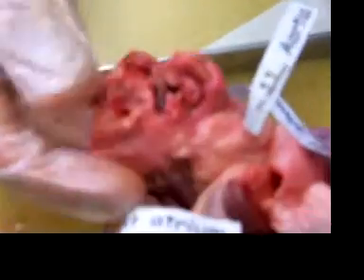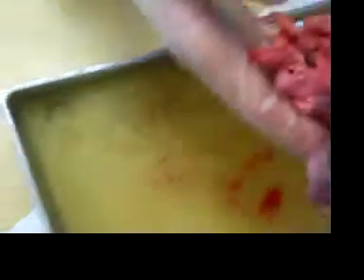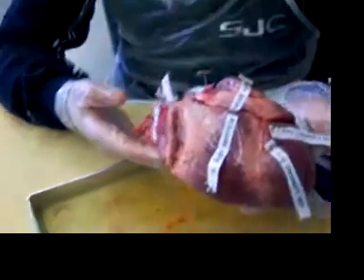Along with a bunch of veins, which we don't know what they are. Mr. G, someone cut off our vena cava. Our vena cava has been cut open, as you can clearly see.